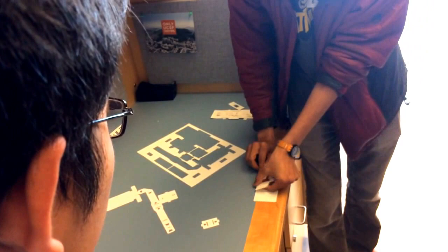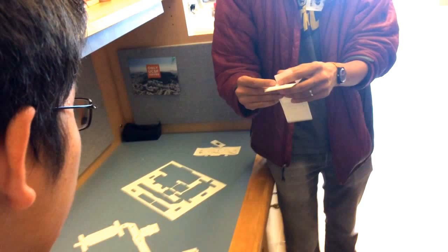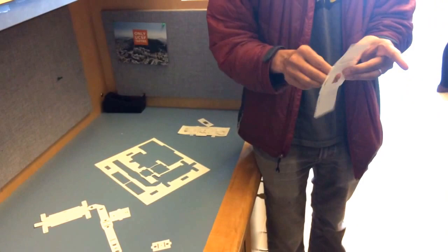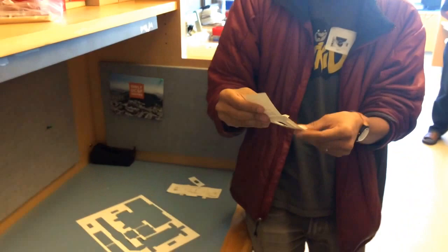And what I'm doing is, and I'm going to try to fold fast because I want to beat my own record. So I'm going to talk less and make microscopes fast. But typically when I do this, I try to explain what I'm doing. What I'm trying to do here is make the location where the slide is mounted. So you immediately notice when this fold is done, we've created this little slot. So that slot is what holds the slide together. But then at that same time, it maintains the different distance between the sample and your objective. So it's very important, right? So this piece one is done.